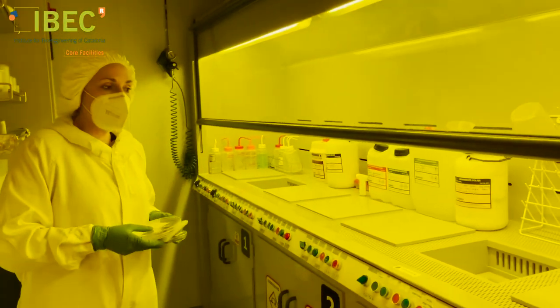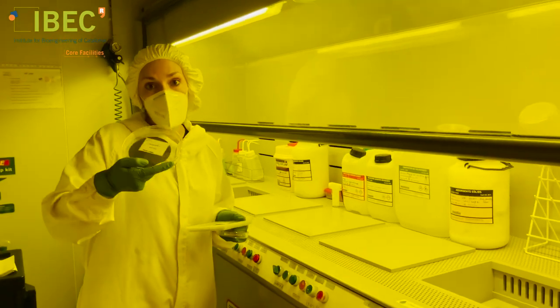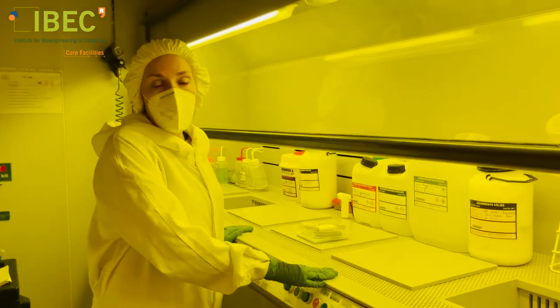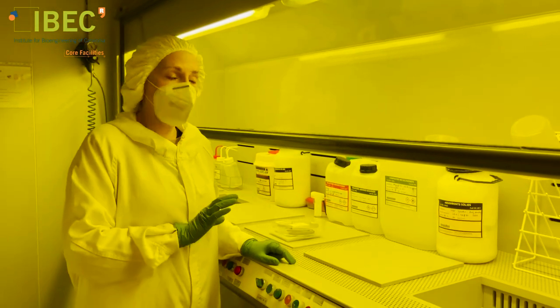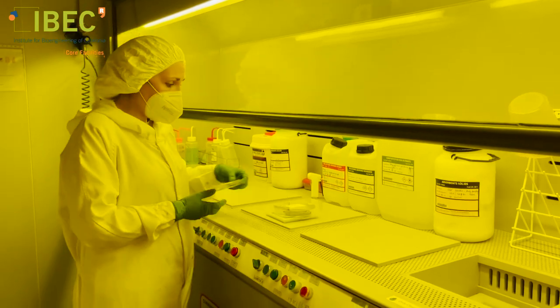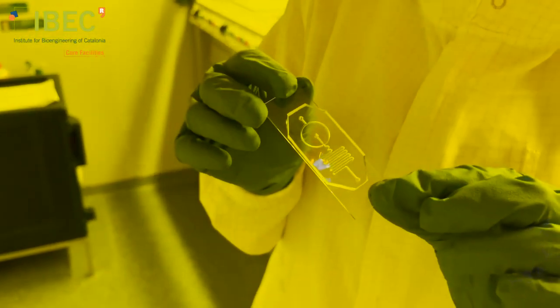These are the chemical benches, and here is where we develop the lithography done in the other area. Once we finish at the mask aligner, we introduce the substrate into a certain solvent and develop the final design. Here we do development processes, cleaning of substrates, and etchings. This bench is prepared to handle all these materials. Something very important in our room is the management of residues — everything used here goes to a specific waste container, nothing goes to regular trash, and everything has a proper disposal process. Finally, once we have a master, we can replicate the structure and at the end get chips like this one — this is a microfluidic chip replicated from one of those masters.